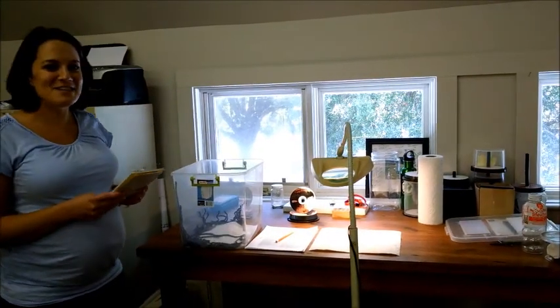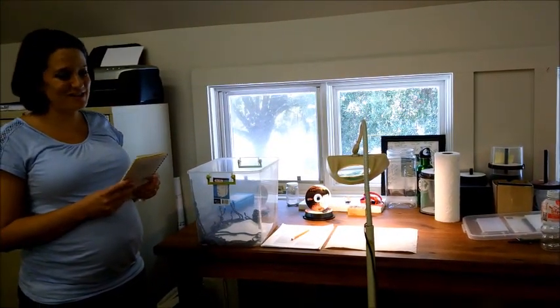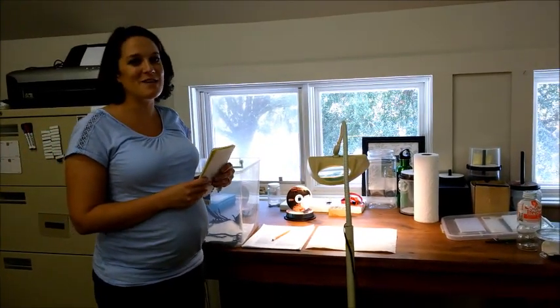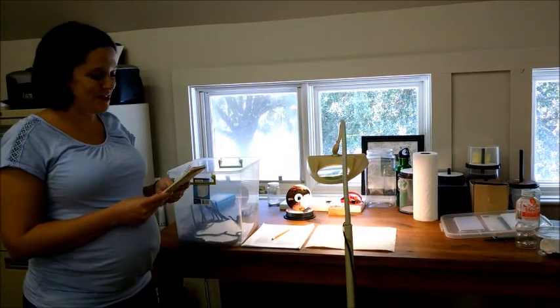Hi, I'm Kristen Mattson, and every day at the Lowcountry Institute is different. Today what we're going to be doing is marking some snakes as part of a research study that we're doing here on Spring Island.